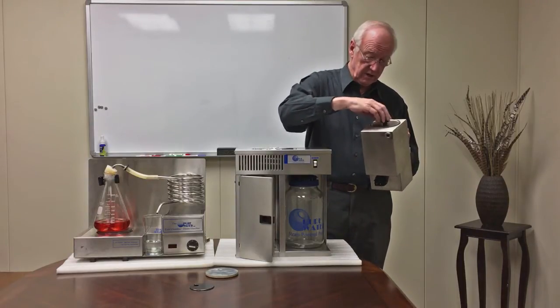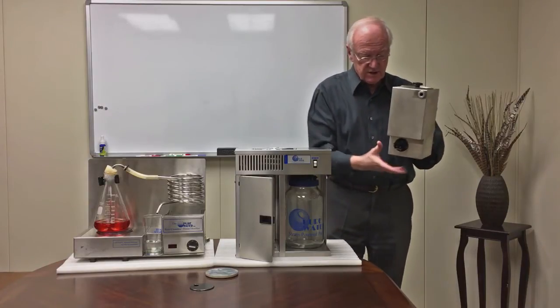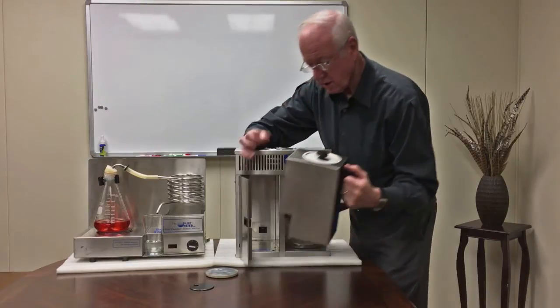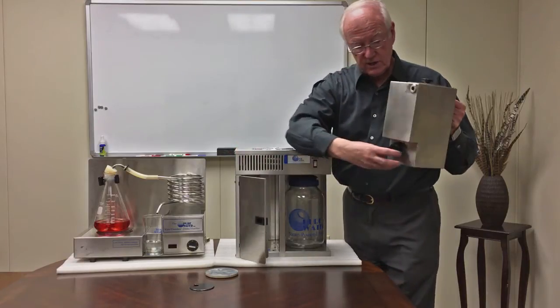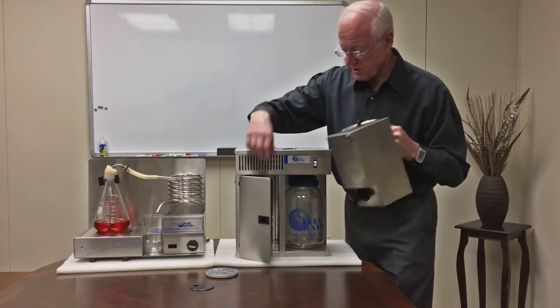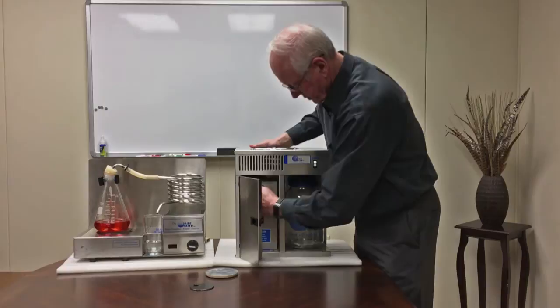Then you put the lid back on securely because we don't want to lose steam out of there. This has got a heating element on it, and when we put it in here it's got a hole for the steam to come out. We push it in, that is the source of the power. This is where the steam comes out.